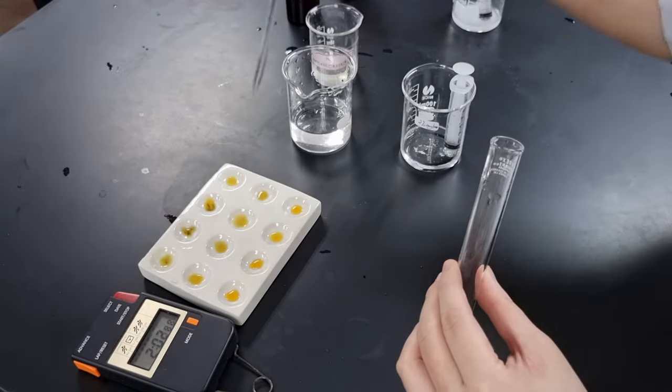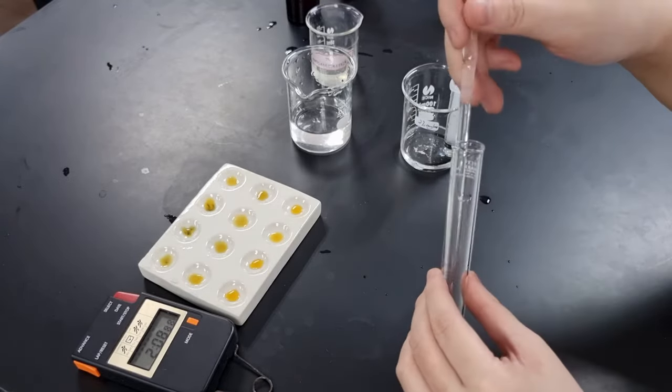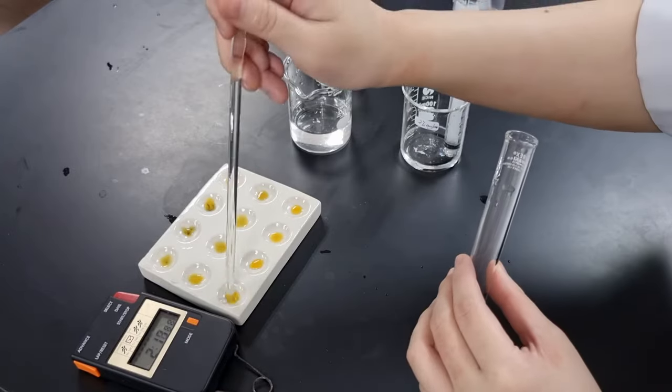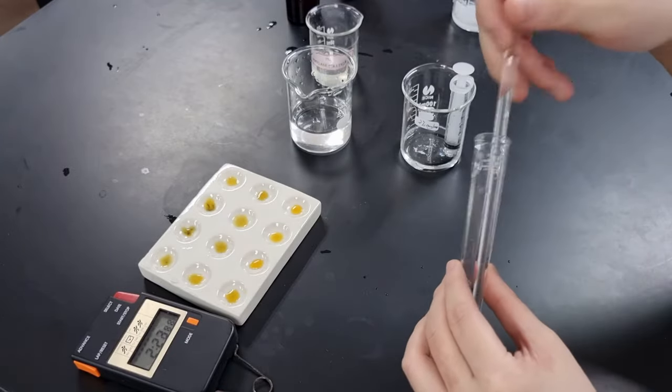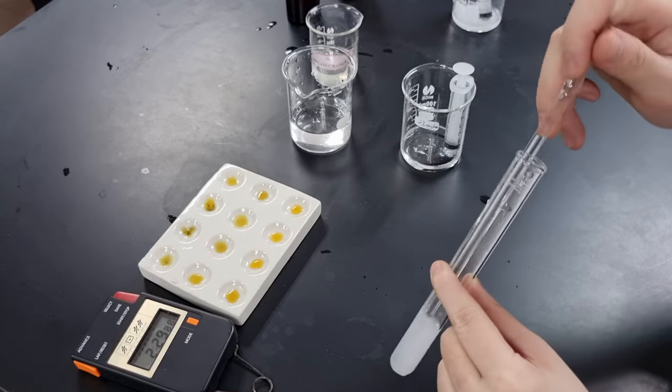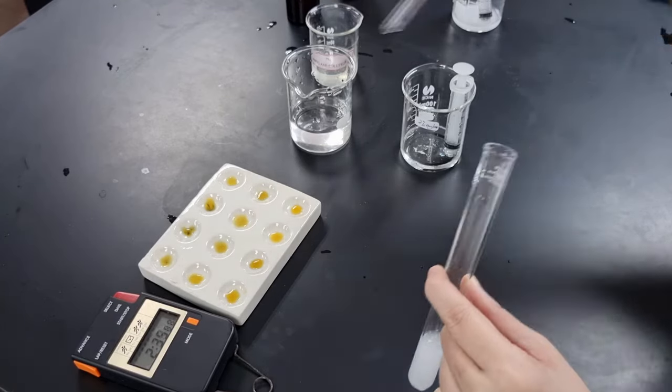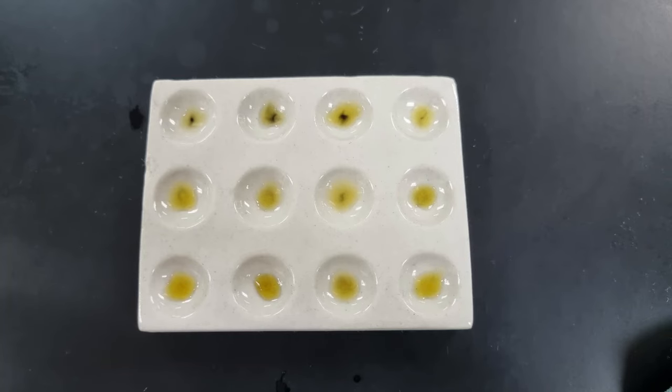I did this for three minutes just to make sure it didn't turn back to blue, but this is actually not necessary. Once the solution has shown you a negative test result, that's probably a good time to stop. This here is the final results that I got. As you can see, in the first three wells, the solution has turned blue.